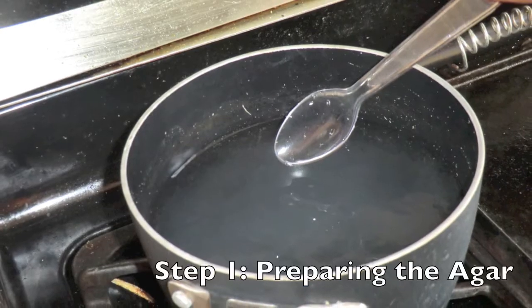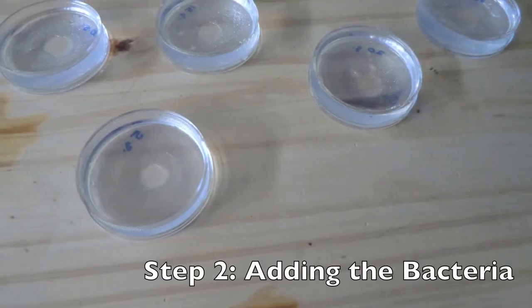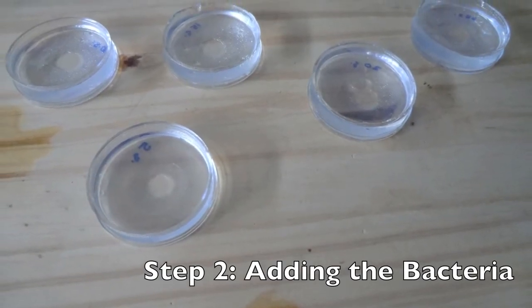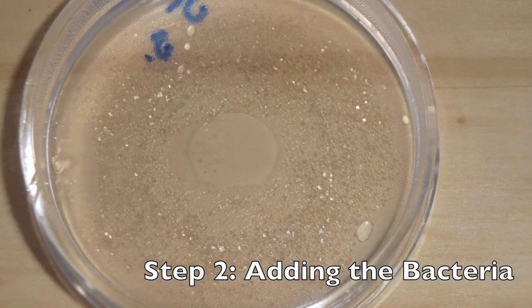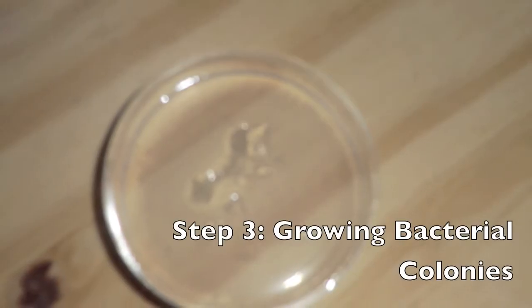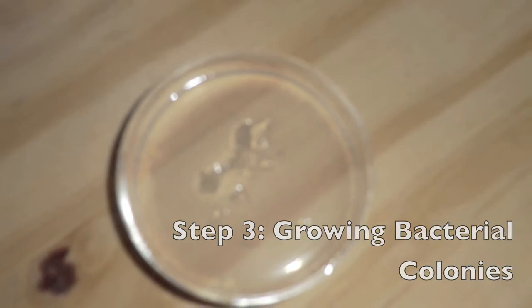To begin, I prepared the agar solution. After that, I collected bacteria samples from the inside of my mouth and added it to the petri dishes. I waited a few days for the bacteria colonies to start growing.